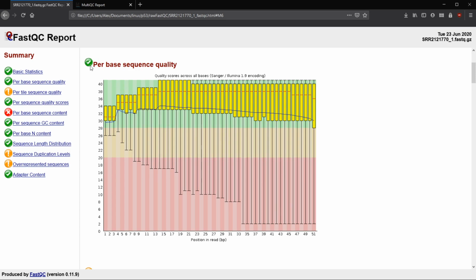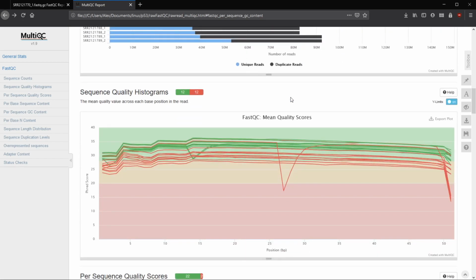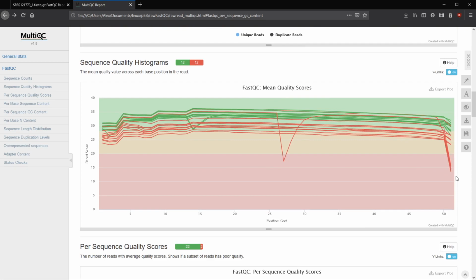For this, we have a pass, so that's good. You can see most of our reads are pretty high. But a warning for this per base sequence quality will actually happen if the 25th percentile here, if a base call for the 25th percentile is less than 10. So we have 10 here. If any of these yellow boxes dropped below 10, we can see in this QC report, we have sequence quality, yep. So this one's 13, so not any of ours drop below, doesn't look like any of them drop below 10. So that's good.